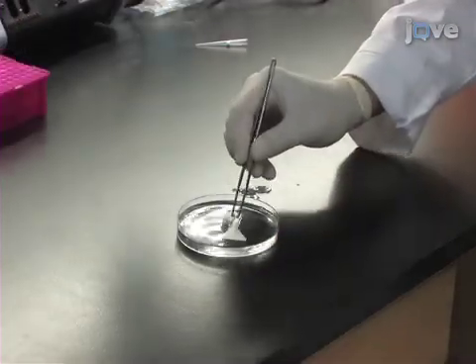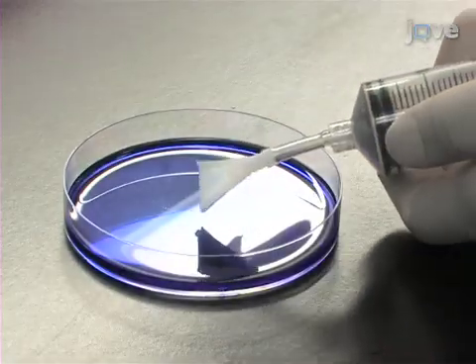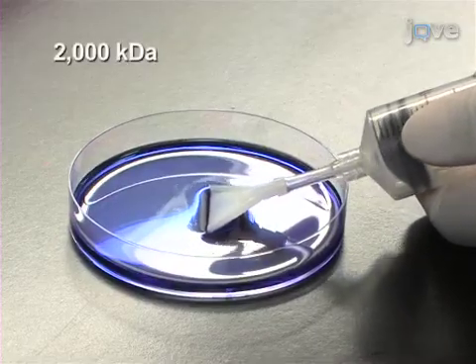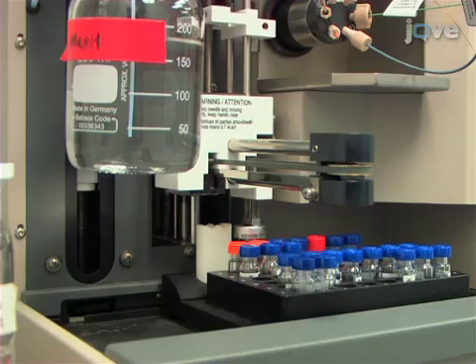Sterilize the probes with 70% alcohol overnight. To evaluate proper sealing, immerse the LLUF probes in 50 milligrams per milliliter blue dextran solution for two hours. Confirm the absence of blue dextran in the collected samples.